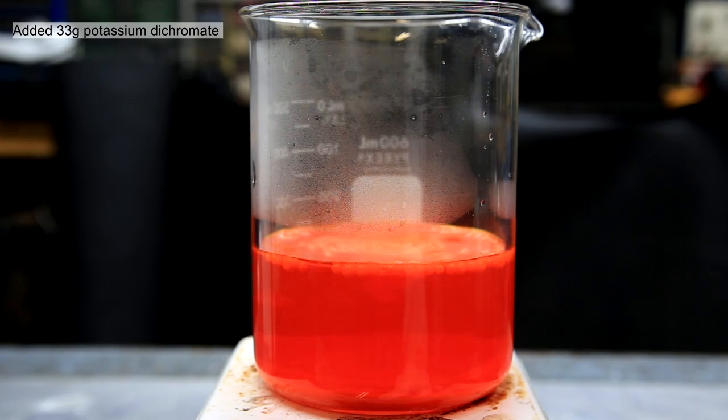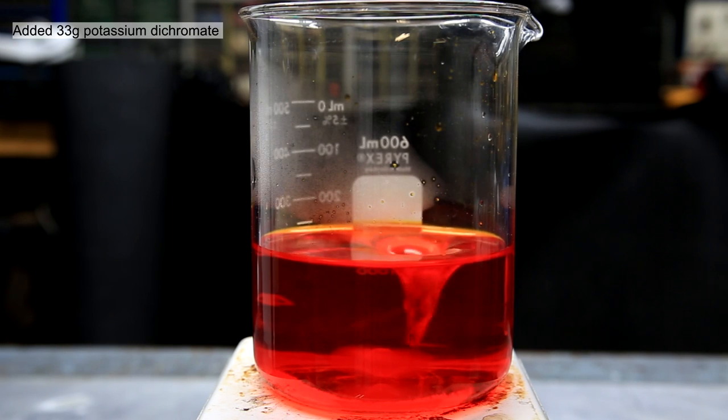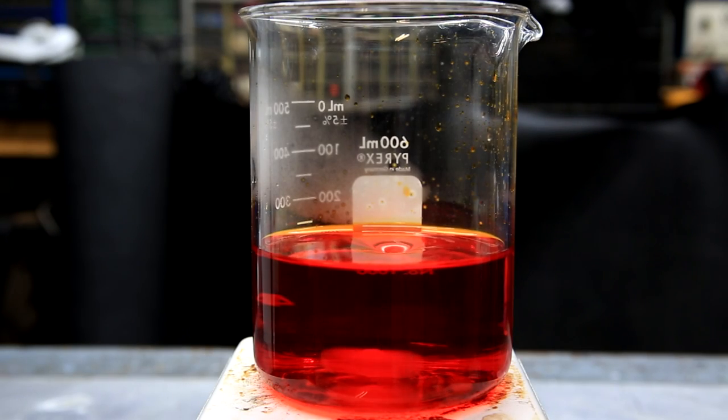With constant stirring, it took several minutes to fully dissolve. Once it's all dissolved, we're left with a nice red chromic acid solution.